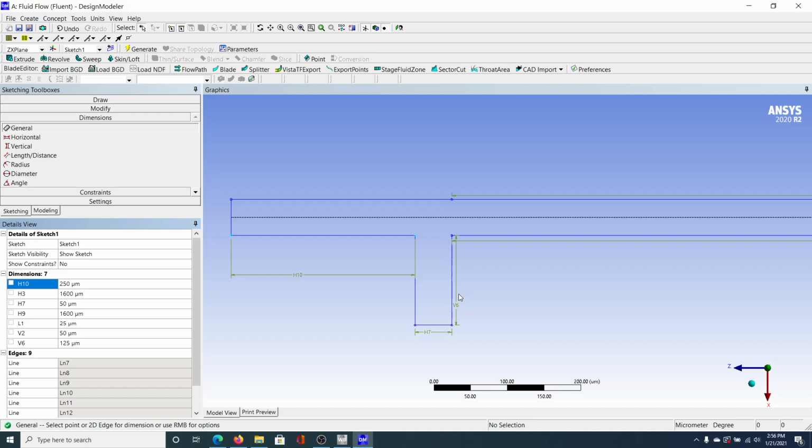Now, the dimensions don't have to be that specific for this. I think the important thing when we're making our other geometries is that just from here onward is 1600 micrometers. And then, for example, if we're doing a T geometry, you would basically select draw a line like this. And then the dimension from here to here would be the same as the dimension from here to there. Okay. So I believe we're done with defining all the dimensions. And we're going to generate.